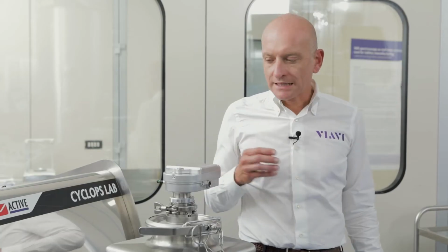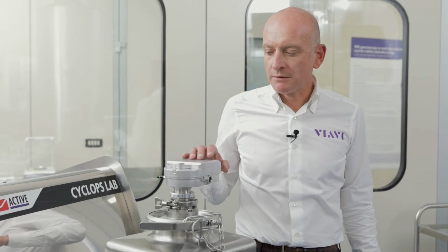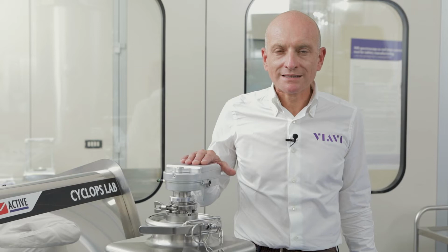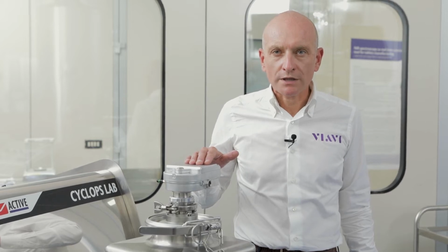In particular, in this case, we are using a PAT-WX, that is the hazard lock certified version of the classical PAT-W. The PAT-WX is, as I said, similar to the PAT-W, a completely wireless device. In particular, it has a battery that has a working time around 8 hours and also 2 antennas in order to enable the wireless communication with the computer.